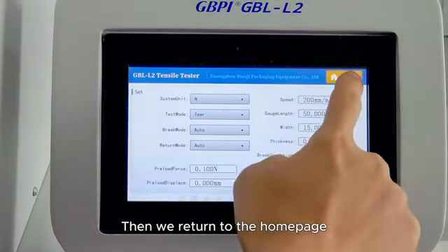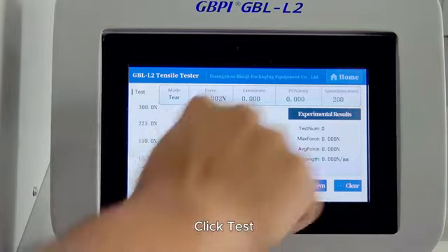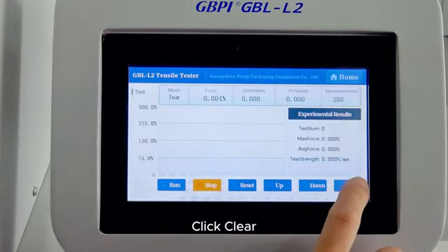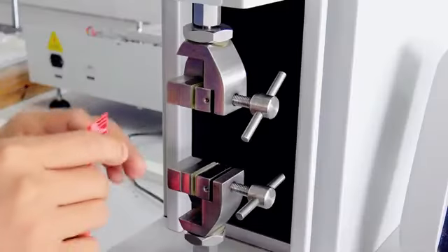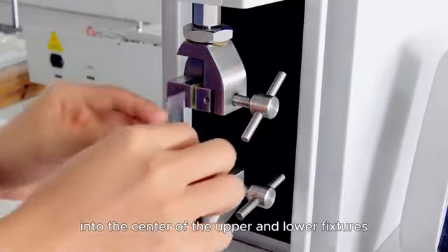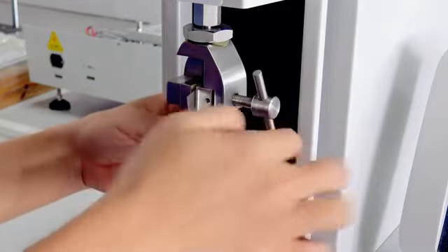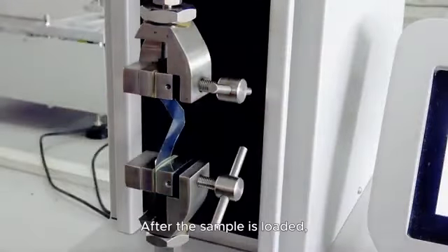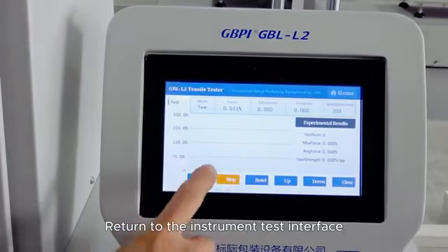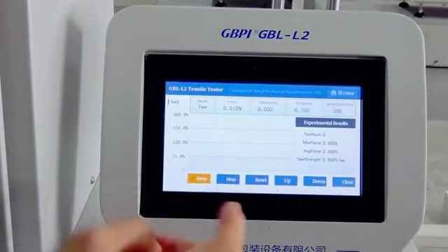Then we return to the home page. Click Test. You can see the tearing mode. Click Clear. The sample is required to be vertically clamped into the center of the upper and lower fixtures. After the sample is loaded, return to the instrument test interface. Then click Run.